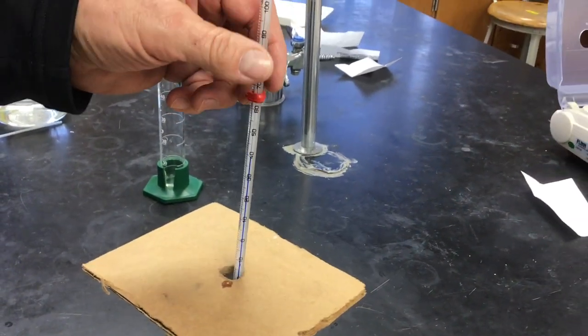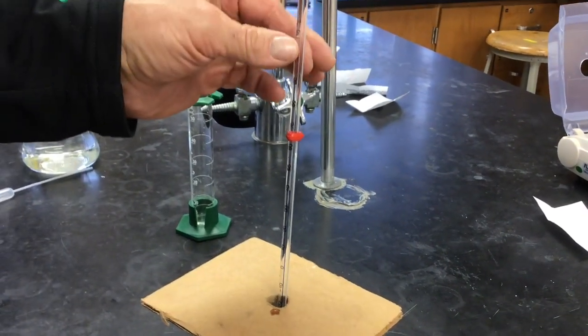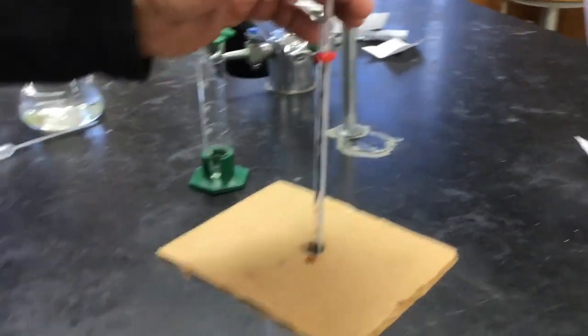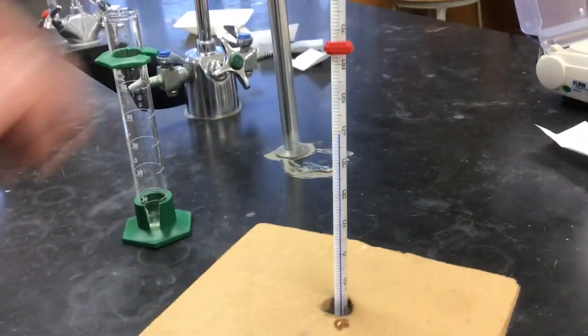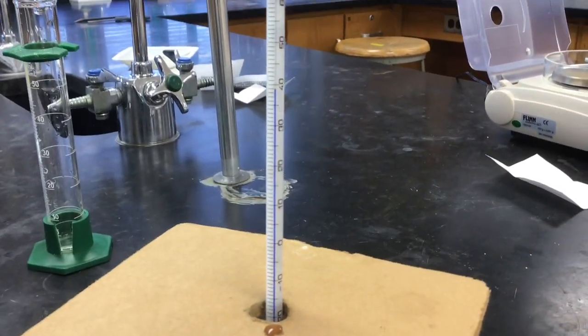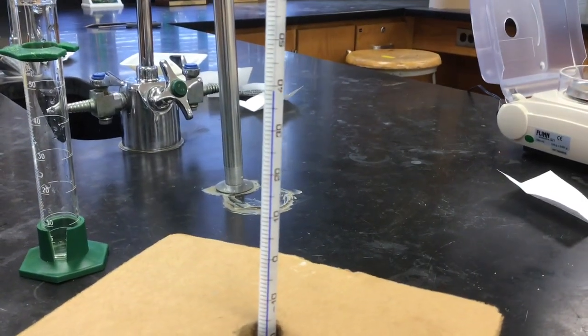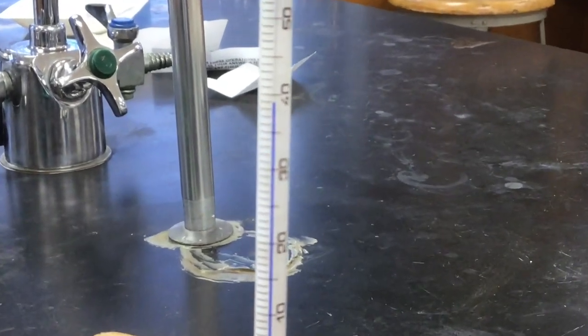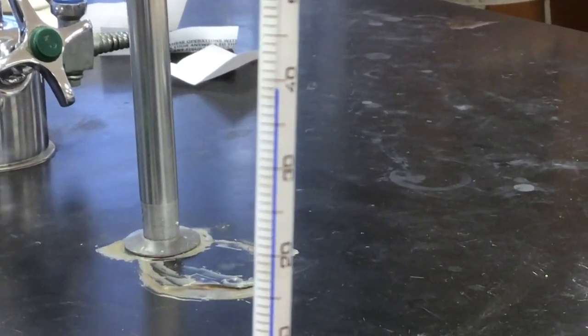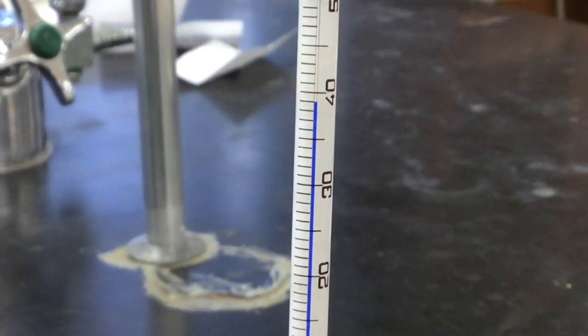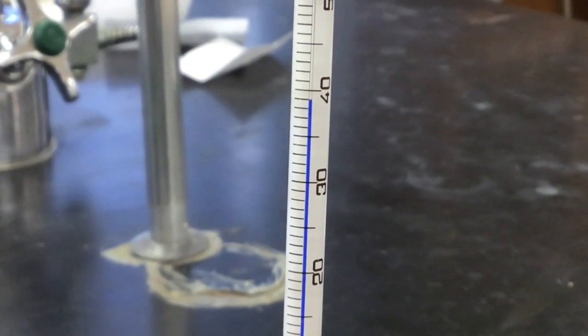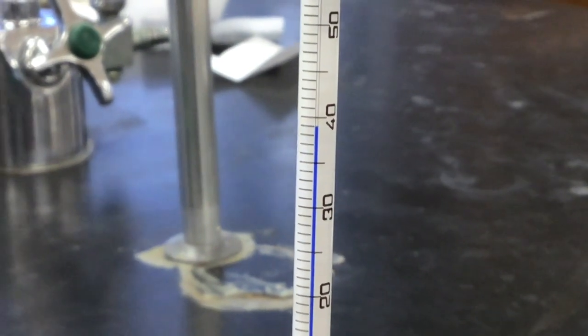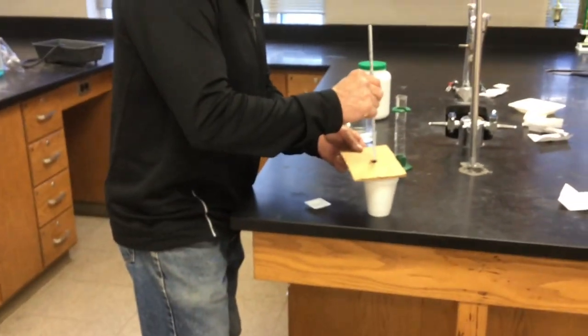You know, I've seen it in its high 30s for a little bit now. I don't know if it's rotated correctly for you. There you go. And I think that temperature is pretty well stabilized. Stabilized. So, we've got our data from the first trial.